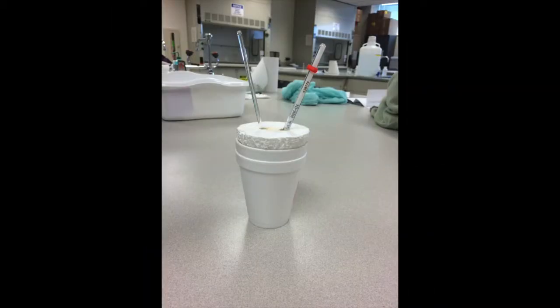The process of using a bomb calorimeter can be followed by any scientifically trained professional adult in a lab setting. The process of using a coffee cup calorimeter can be followed by anyone of high school age or older in a lab setting and under proper supervision.